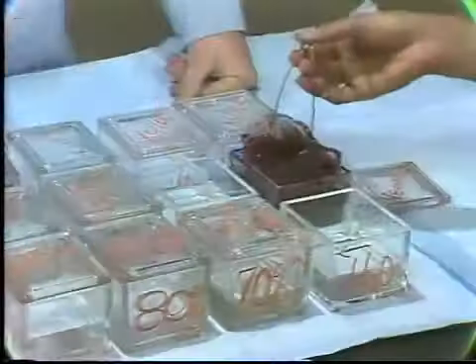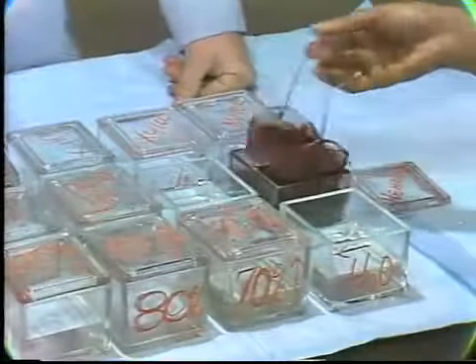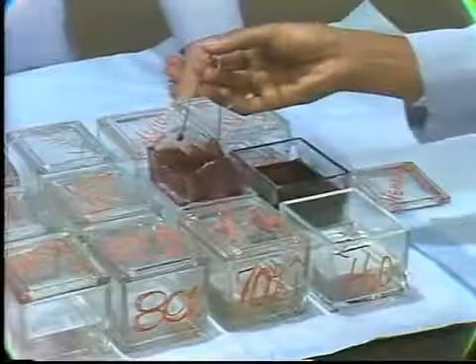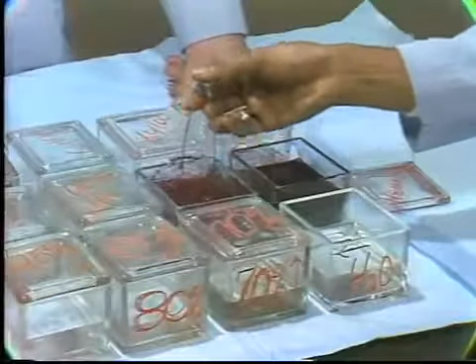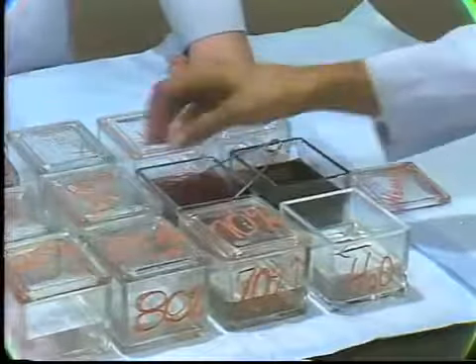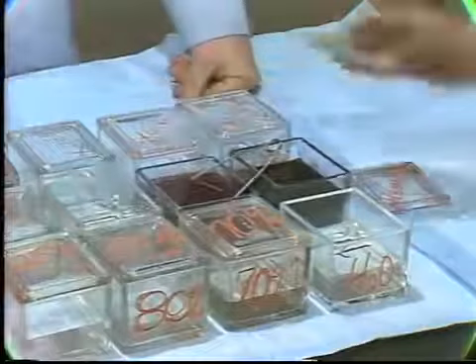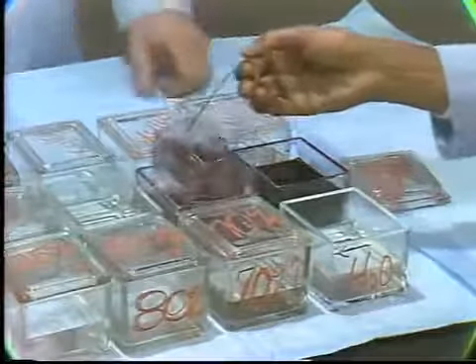The tissue is passed through these at different time intervals. We're removing it now from the hematoxylin into a differentiating solution. Then later we'll remove it, place it in these baths up to eosin. Then we'll dehydrate the tissue.